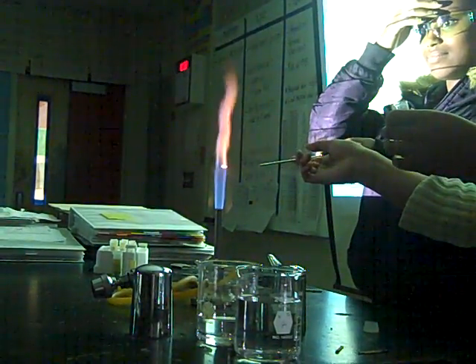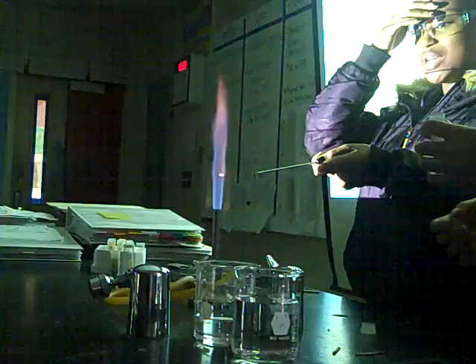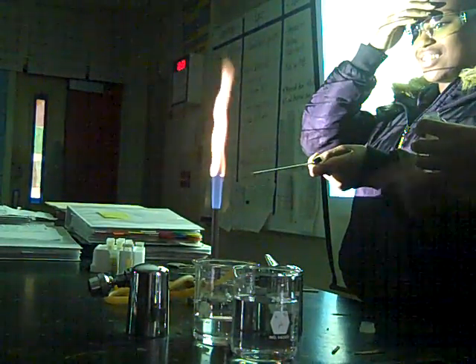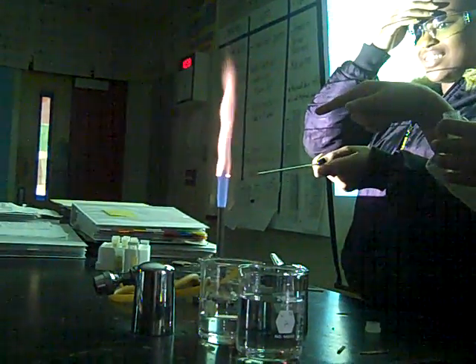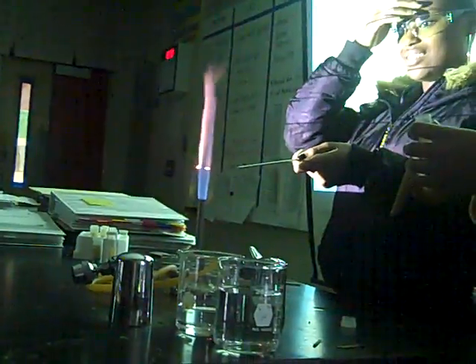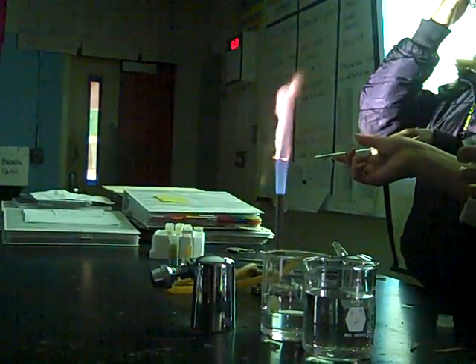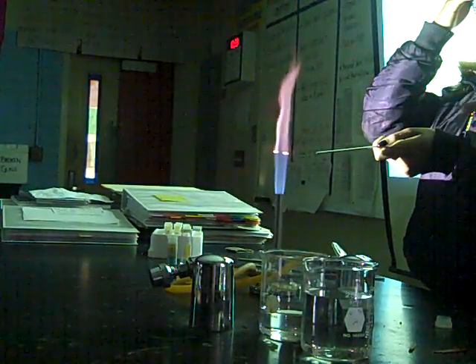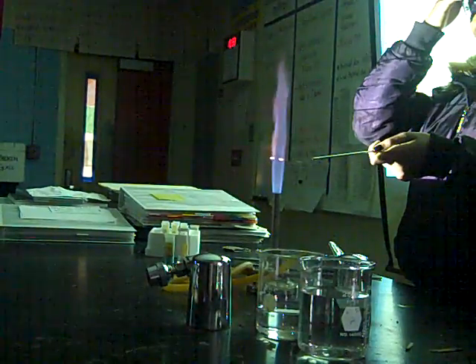What do you guys see about that color? It's Tampico. Ooh, that. Oh, there, right there. That, right there. What do you see? What color is that? Tampico. All right. Yeah, right there.